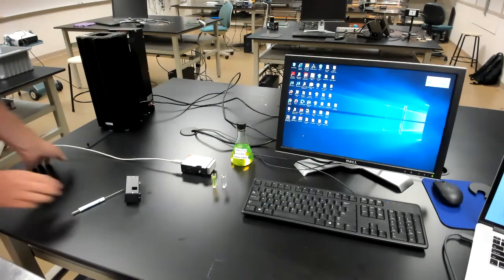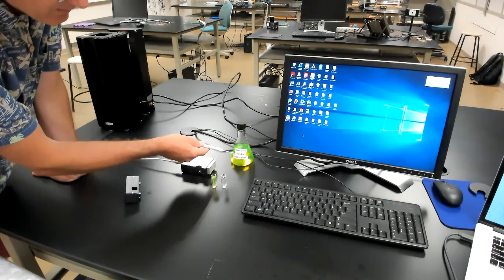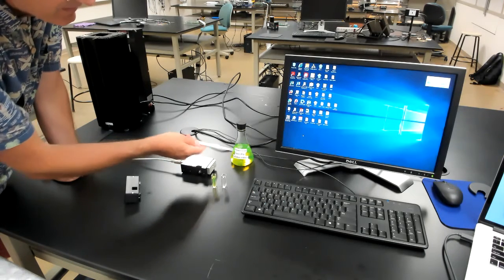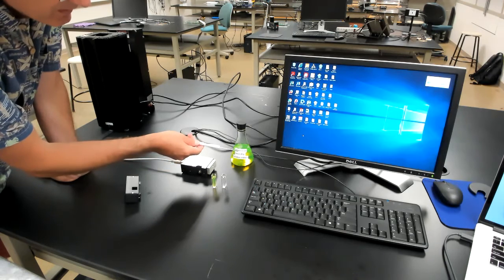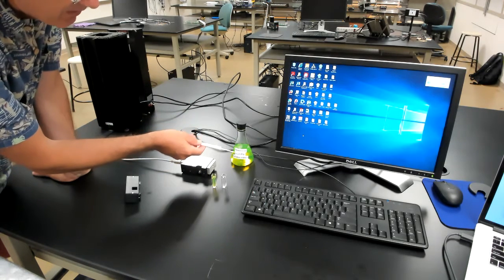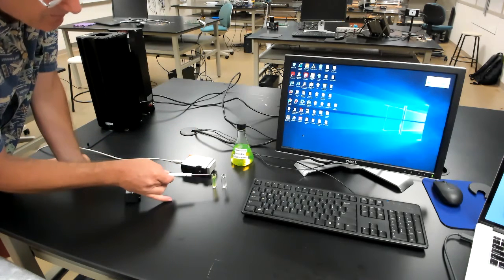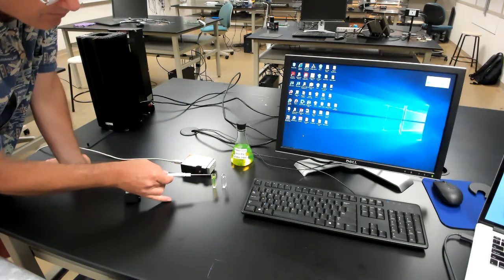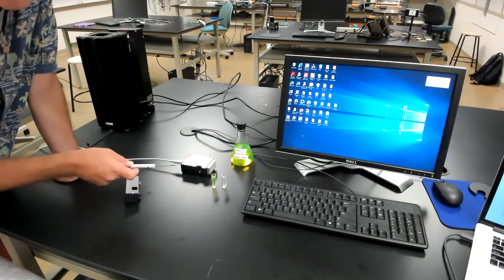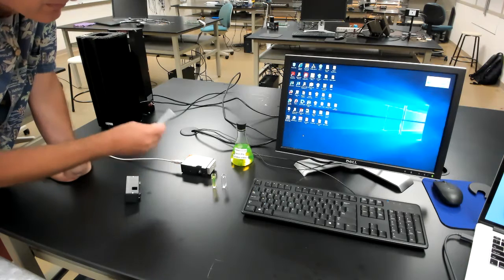What that means is that we're going to do an absorption measurement, or equivalently a transmission measurement, on a sample. In this case, for the purposes of this video, I'm going to show you the transmission spectrum of this green dye. So I have a sample of the green dye here, and what we're going to do is place that between a white light source and our spectrometer and see which wavelengths of light the green dye absorbs.